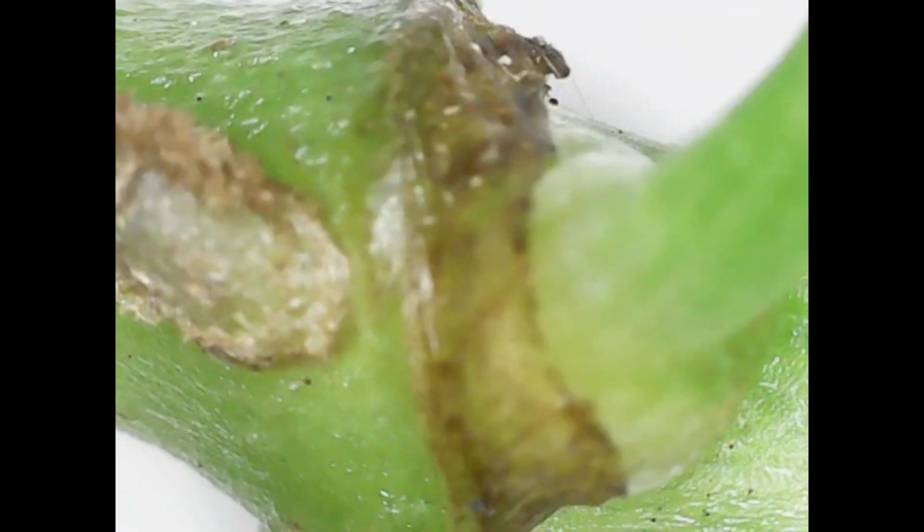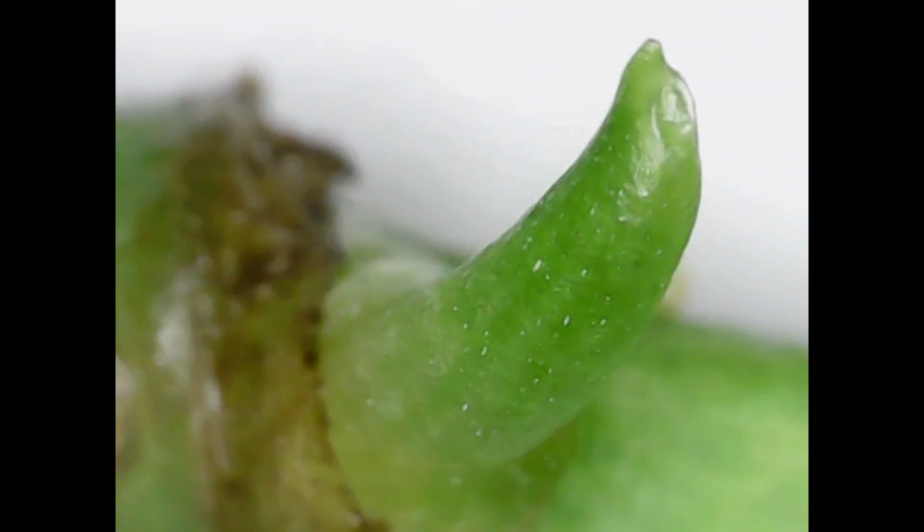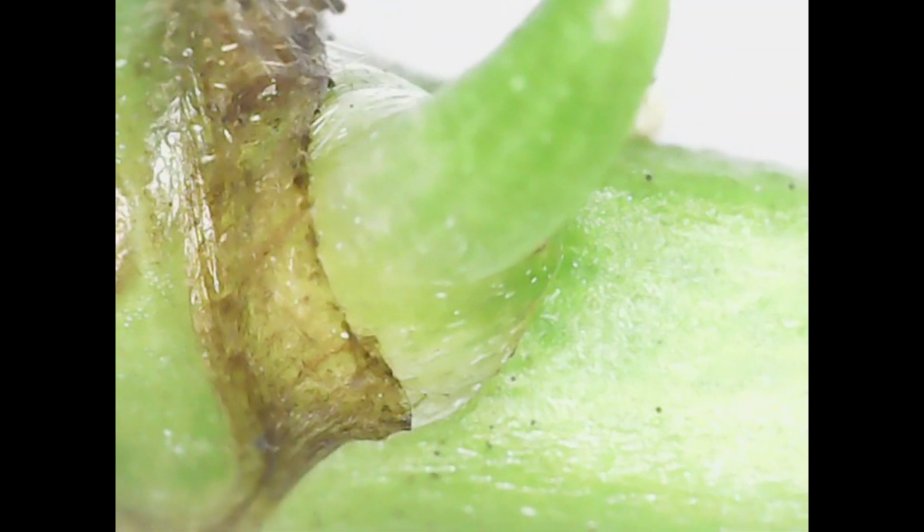In this section now, we're going to look at what a node looks like. And this is a node not where the aerial roots are, but where the growing tip is going to form from the node, essentially. And you can already see, if we look at this just now, you can start to see that's where the node is, and there's the growing little tip, essentially. So you might be able to see in a moment when it focuses a bit better where that leaf is going to split and emerge from, that very top there. And you can see how it's coming out of the actual node itself. That there is a dried cataphyll.